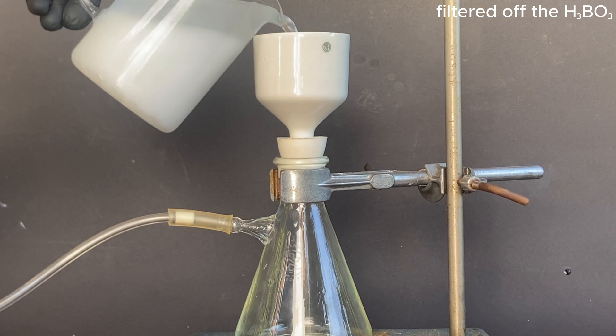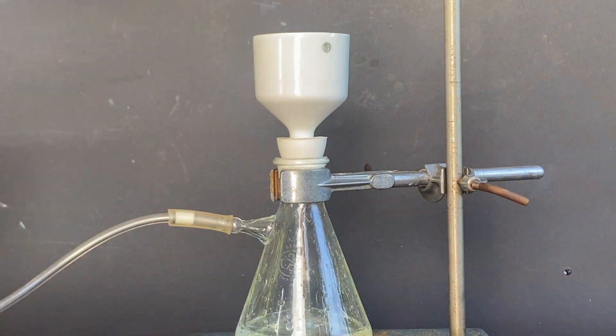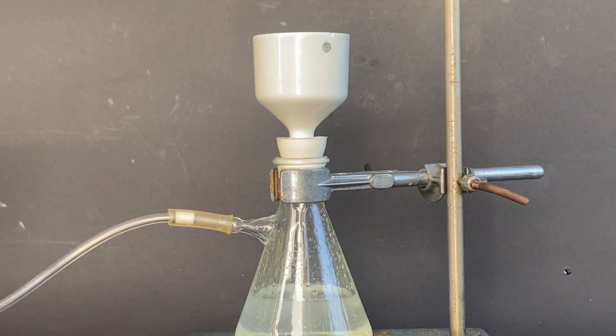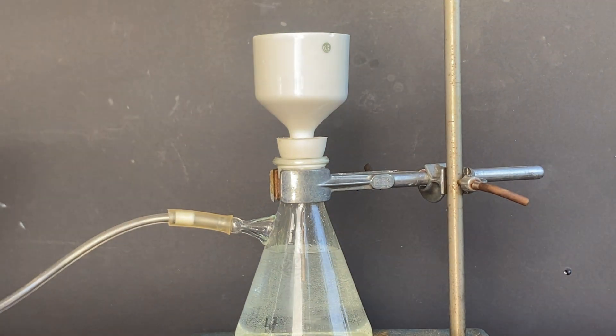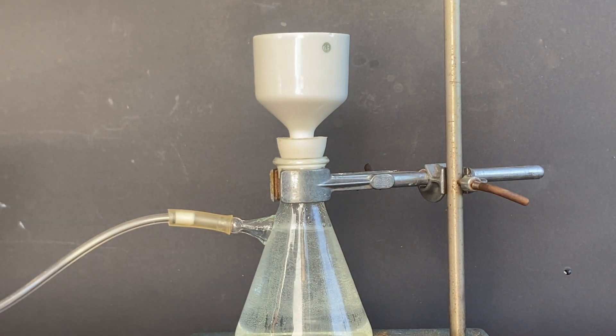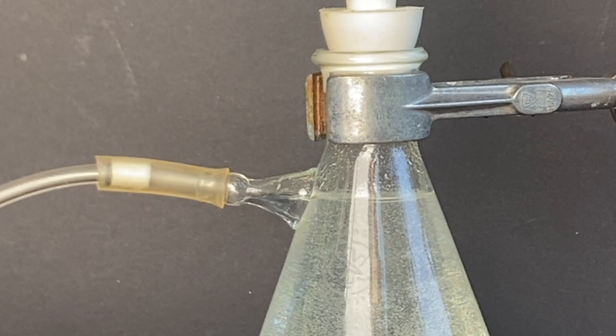Next I vacuum filtered the boric acid and almost drowned my pump in the process.